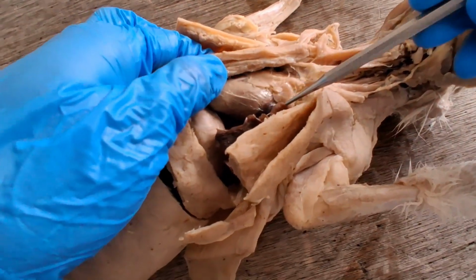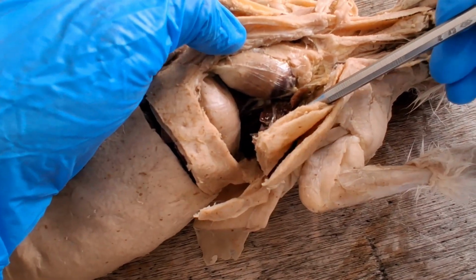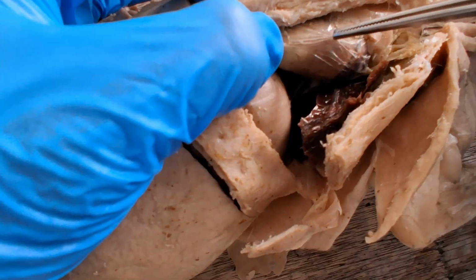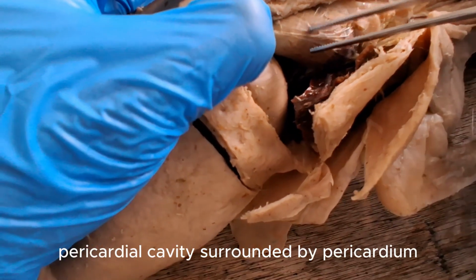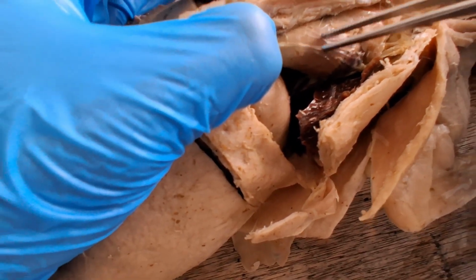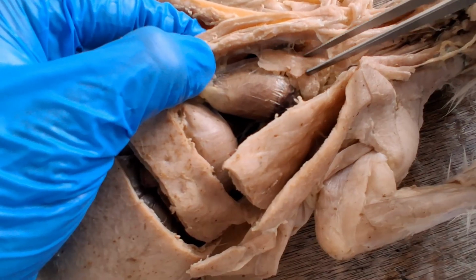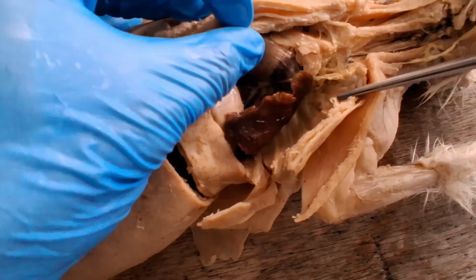And this one smack in the middle is the heart, which is contained inside its own cavity, the pericardial cavity. So you see it's covered by coelomic membrane, and the cavity covered by this membrane inside would be the pericardial cavity. The one that I'm pulling is the parietal pericardium or pericardial sac. This gland or gland-like structure at the base of the heart is the thymus gland. Produces white blood cells, specifically T cells.